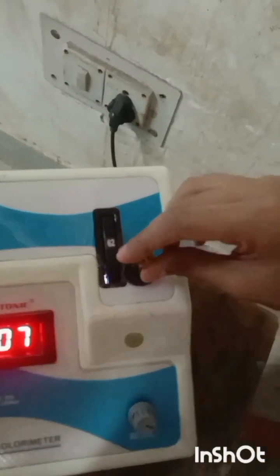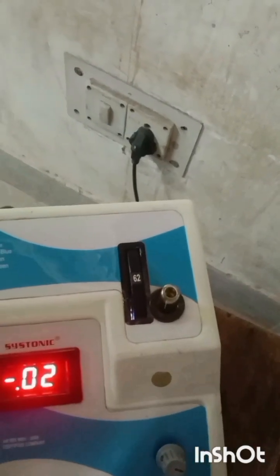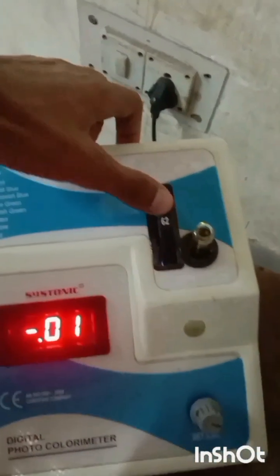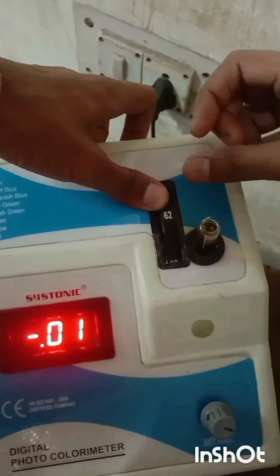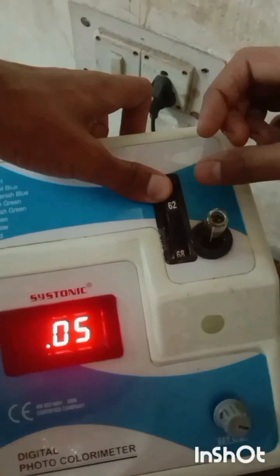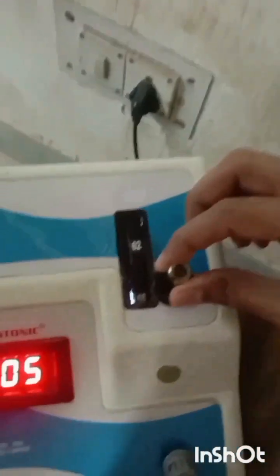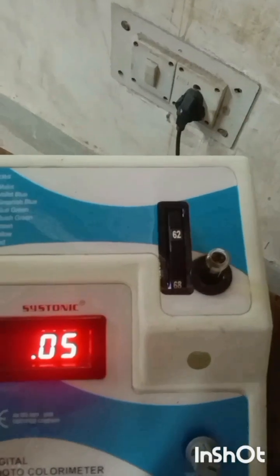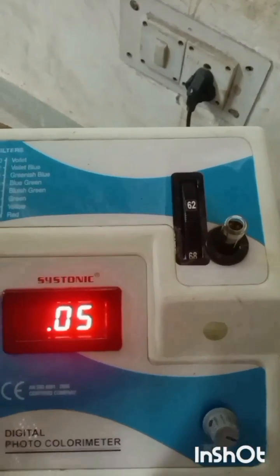These are the respective absorbance values for our solutions. For the solution of 0 ml potassium dichromate in 10 ml water, the absorbance is 0 — already auto-set. For 10 ml of potassium dichromate in 0 ml water, the absorbance value is 0.98, which we calculated in the first step.